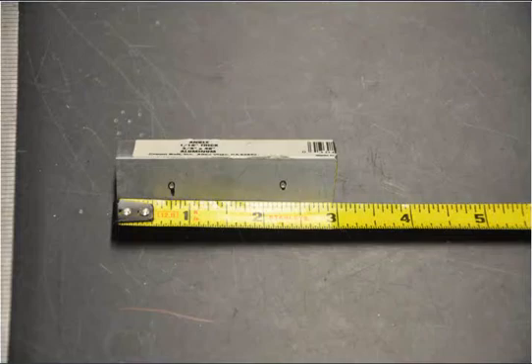After I drill the holes in the second plate and it all lines up fine, I'm going to cut a 3-inch little angle aluminum piece, and drill two holes there, 3/4 of an inch from the edge in the center of one side.